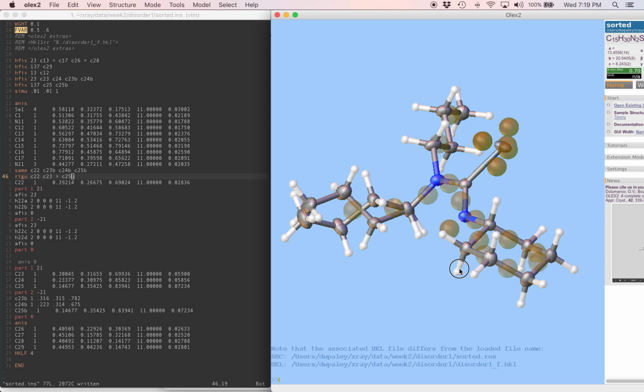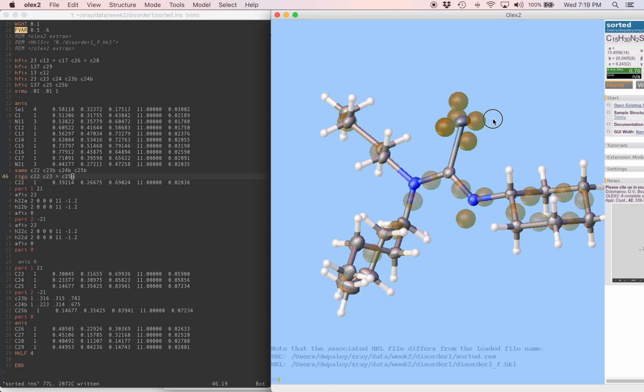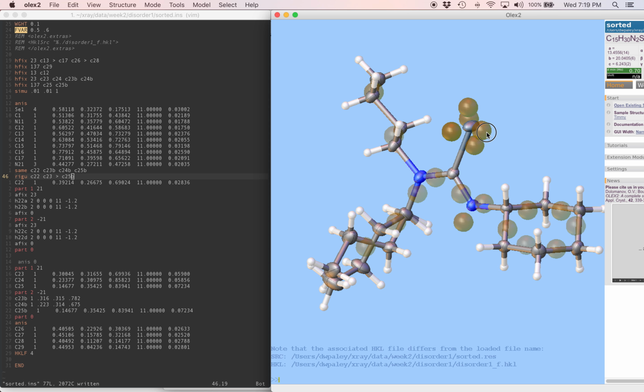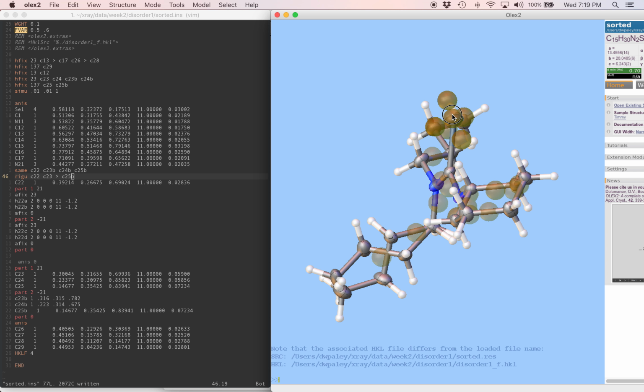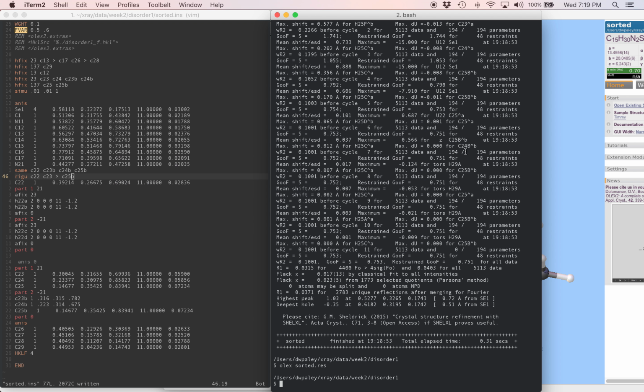This all looks really good. The strongest difference features, we can see that they're around the selenium atom now, and that makes sense. They will tend to cluster around the heaviest atom. We'll check in with the R factors and the size of the difference map.